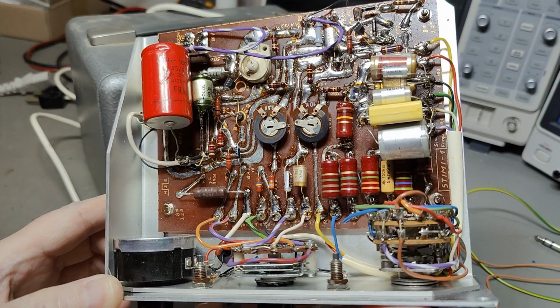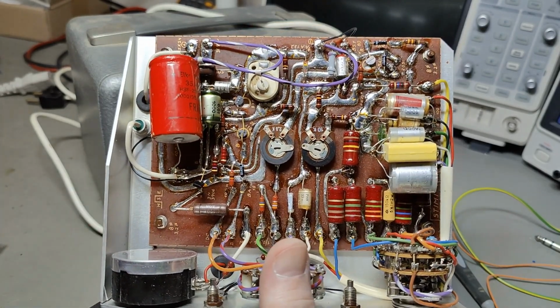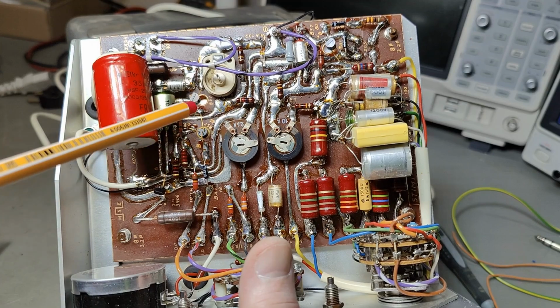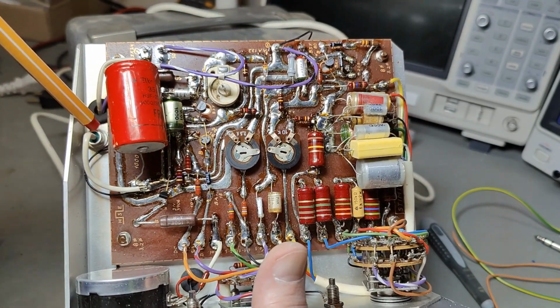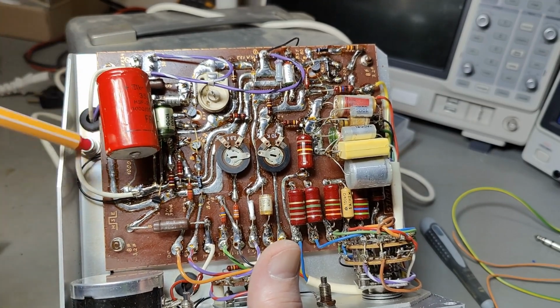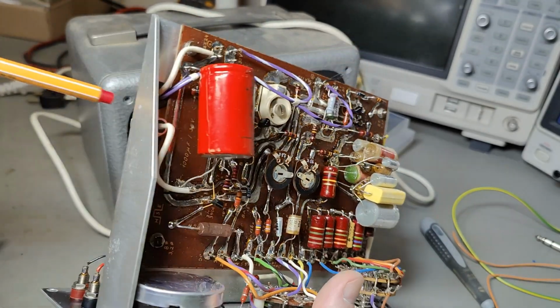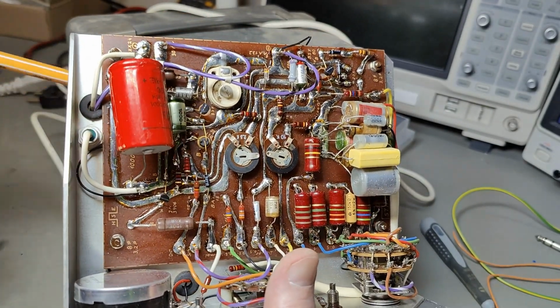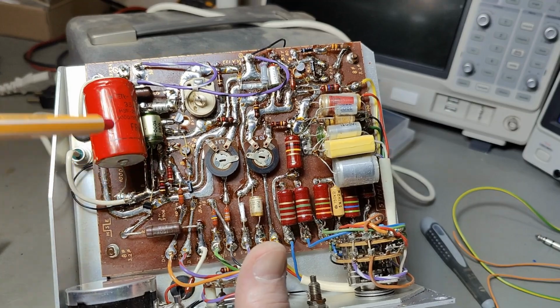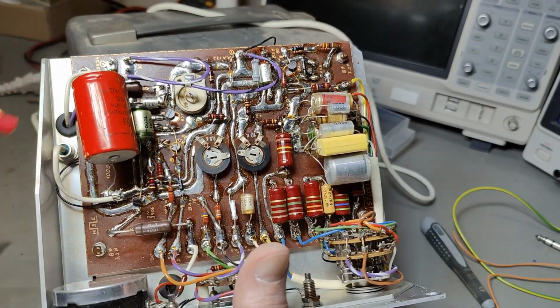So if I look a little bit careful here, what I find is only four transistors and five diodes, if I'm not mistaken. Let's get a lot more light. So here's a transistor, diode, transistor, transistor. And then there's, of course, a power rectifier diode, a single wave rectifier diode to make the voltage. I bet it's this one, right? So these two windings here, that will be the input from the transformer. And yeah, we got 15 plus 15, so that's 30. And then it goes probably via this to that one, right? And then we've got another transistor, two diodes. And that is, yeah, all there is to it.